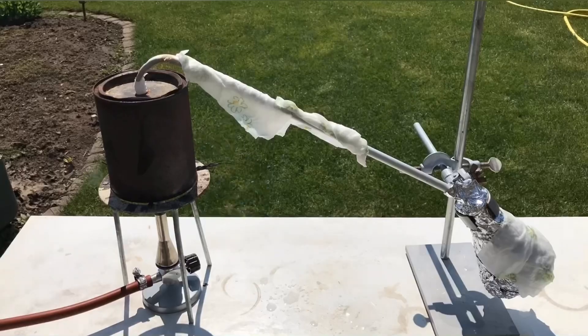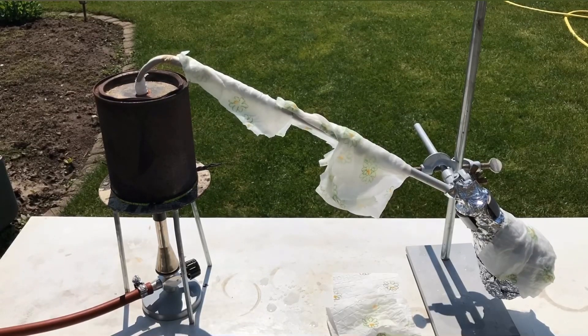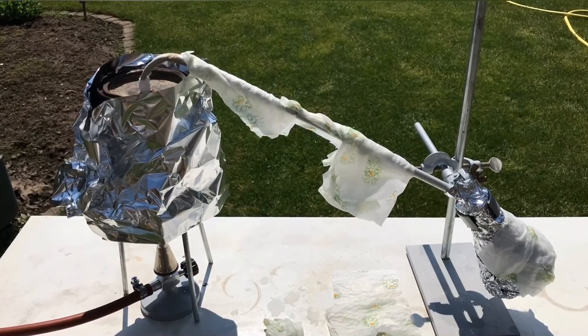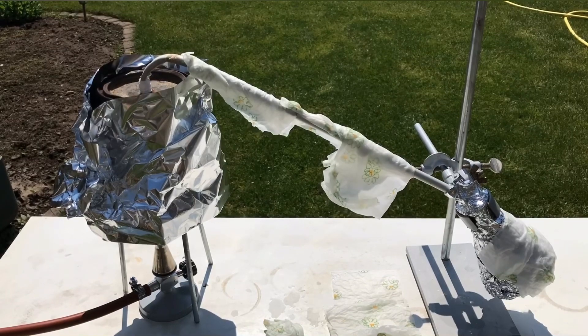The product is light sensitive and care should be taken to keep it away from light, otherwise it may polymerize again. With the help of a Bunsen burner, the PMMA should decompose back into the monomer.